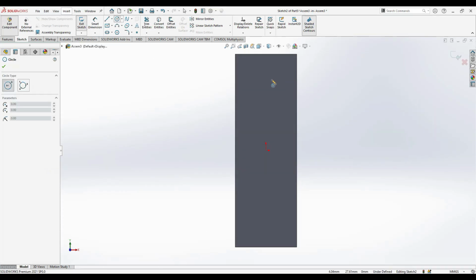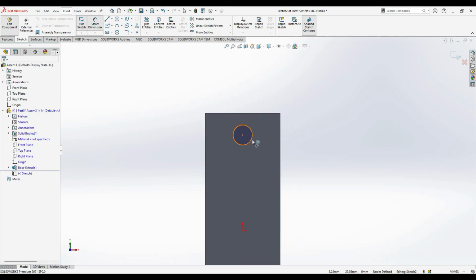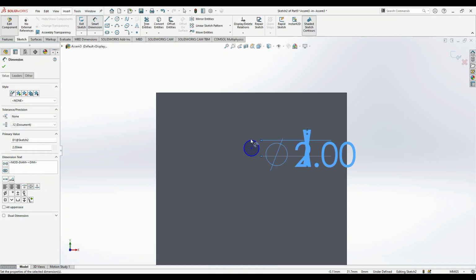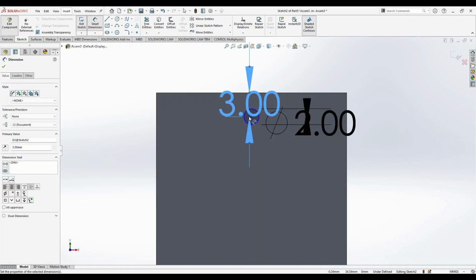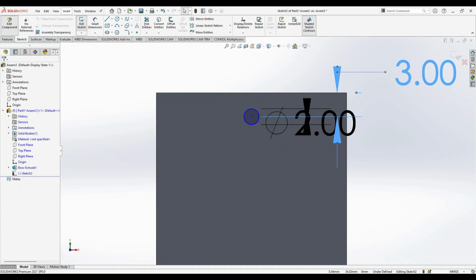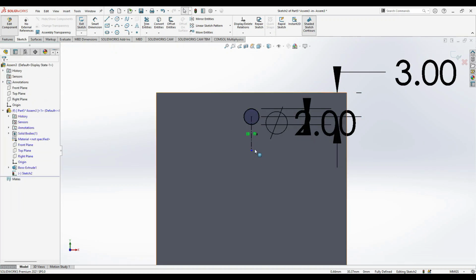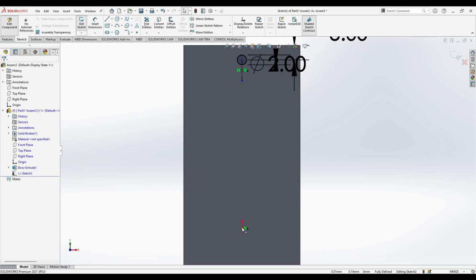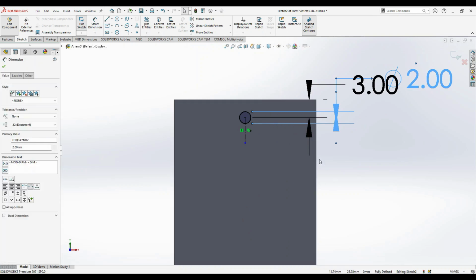To do that, first of all, we just draw a circle. The circle was given a diameter of 2 mm. Okay, and we constrain the circle with respect to the edge, and for now let's keep it as 3 mm. We can see it is still blue in color, that is underdefined. So once you create a center line, that center line is now collinear with the center, so that it changes to a fully defined case.